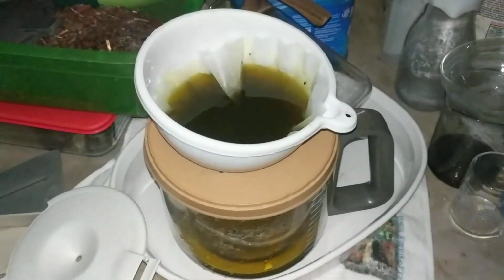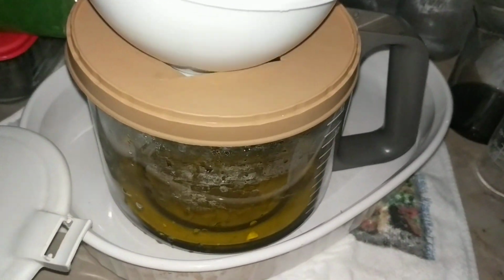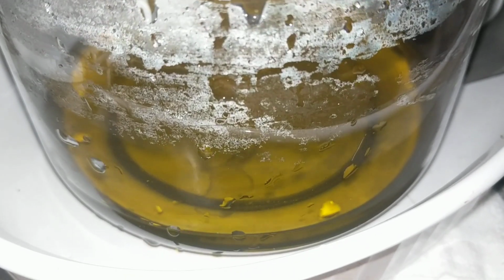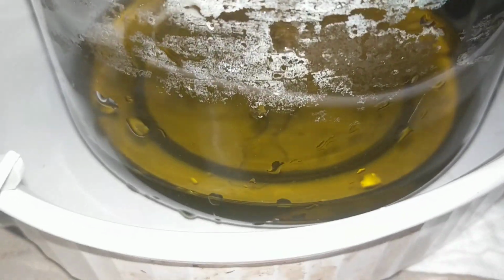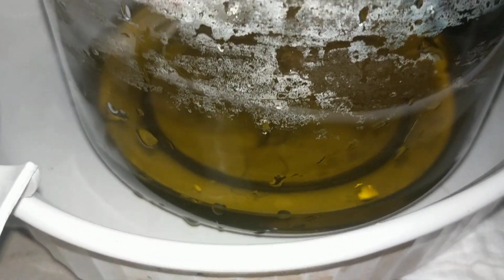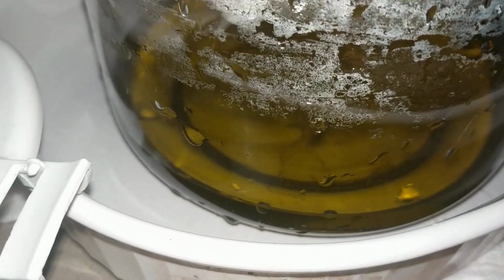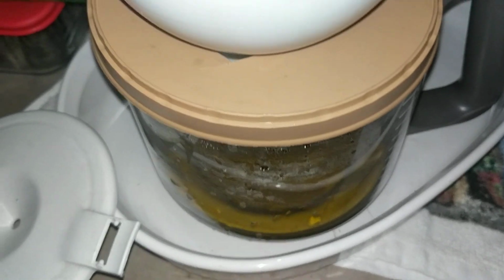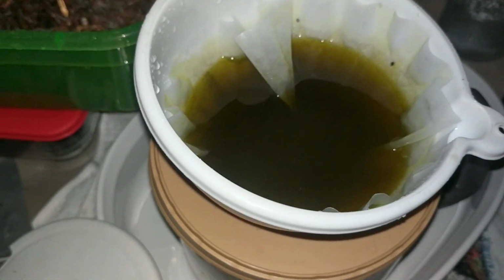Okay guys, so what I had to do is the powders, a lot of it got tied up because I didn't take all the nitric out, just like I said, remember? And so the powders I did get to come out, I mixed that with the foils I had from the 3 pounds I had in AP for 8 months.